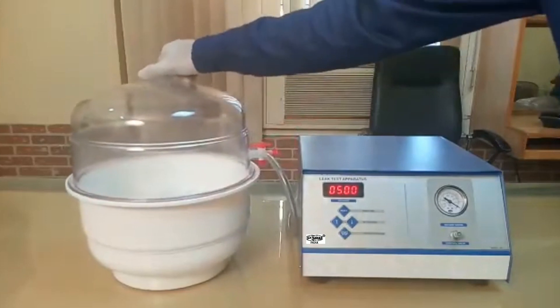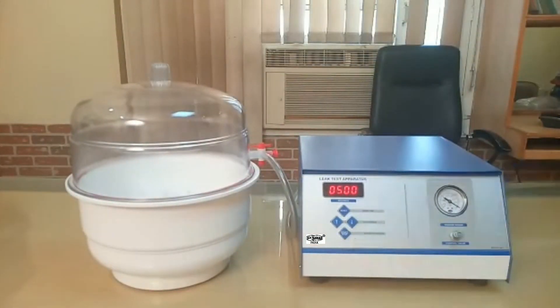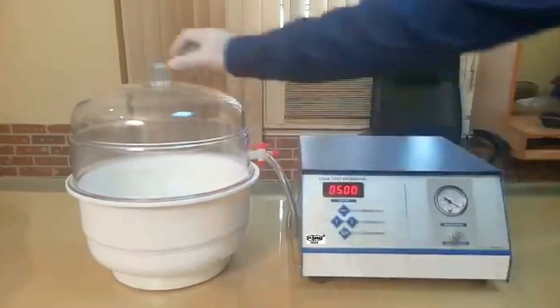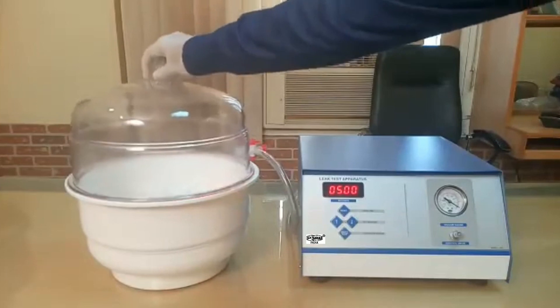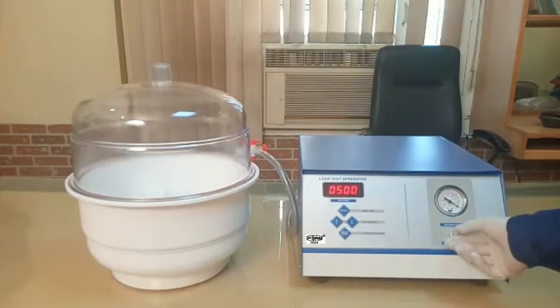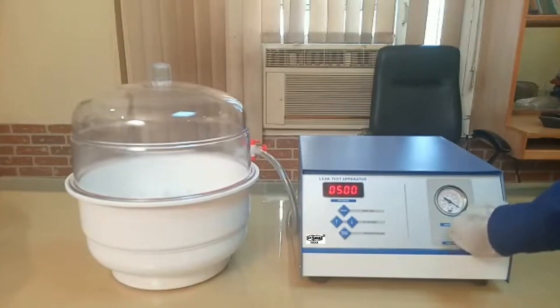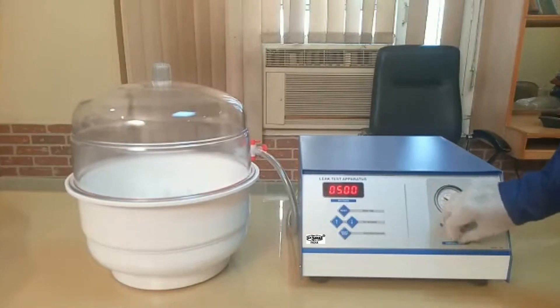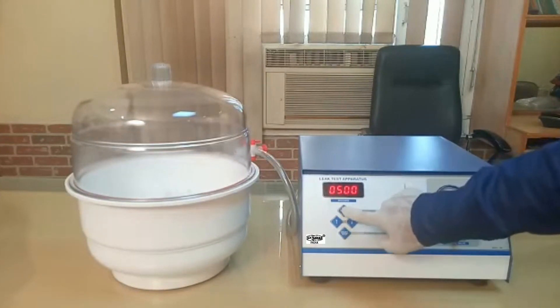The gasket is already set. To start, insert your sample inside the desiccator. Once done, open this valve — the valve is currently tightly closed. You have to open this valve completely by rotating this knob anti-clockwise. Once you move it anti-clockwise, the valve will get open.